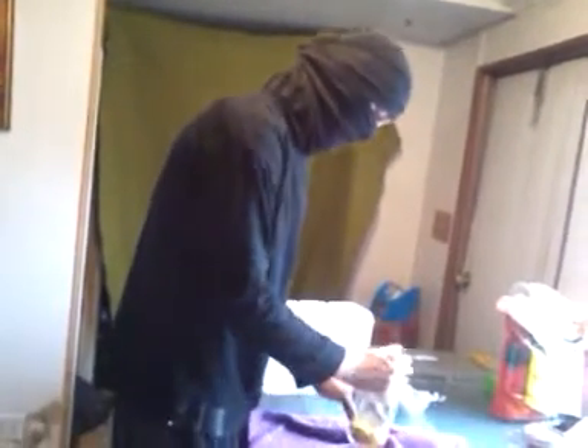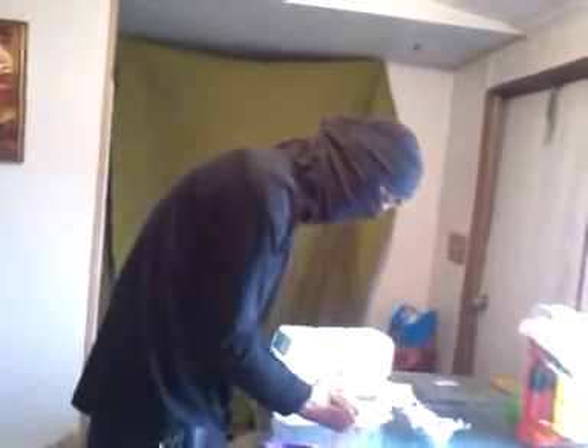Put the dried corn back into a jar. Make sure they're dry. Fill the jar with the soaked, cooked, and dry popcorn. Make sure that you have rinsed this popcorn very, very, very thoroughly before filling the jar.